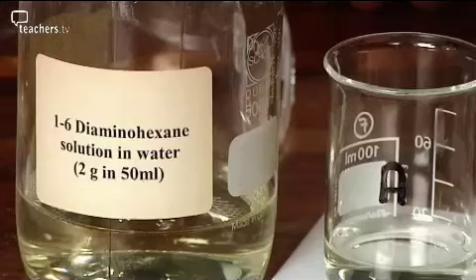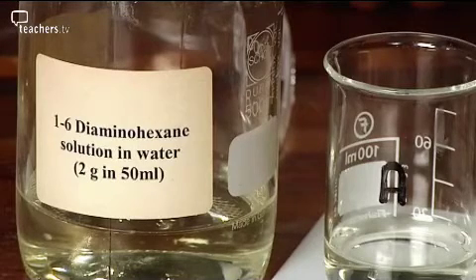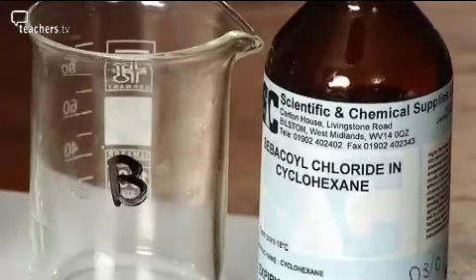So what is it that goes wrong then, commonly? Right, the most common error is getting the 2 layers the wrong way around. We need to pour our aqueous solution of the amine in first, and then you pour the sebacoyl chloride in, the organic solvent, on second.